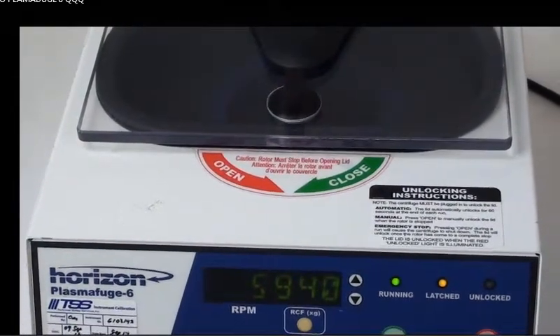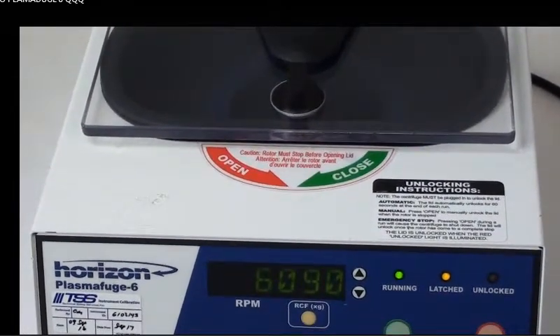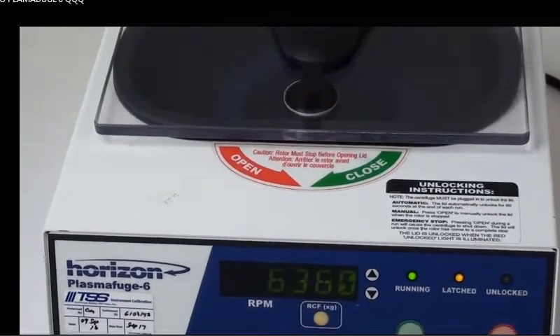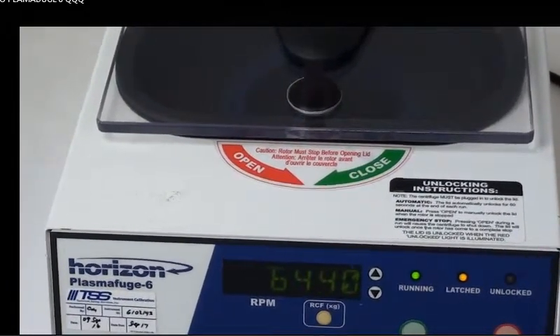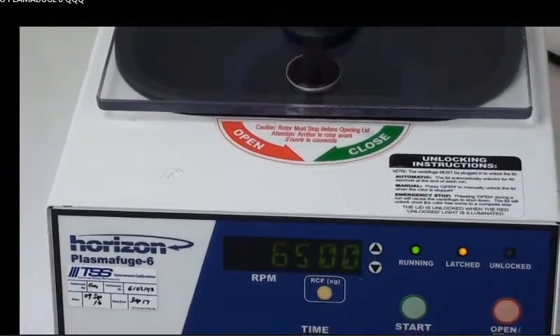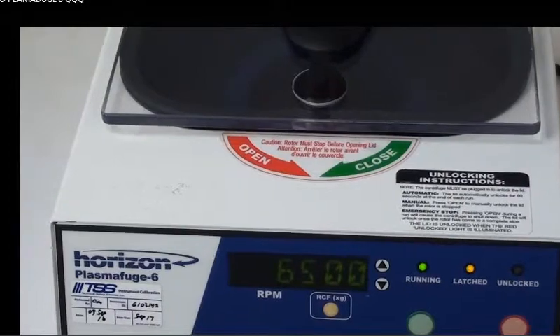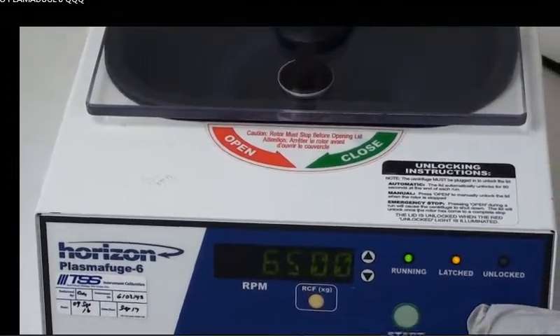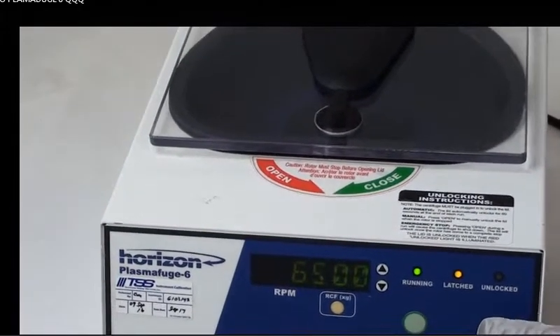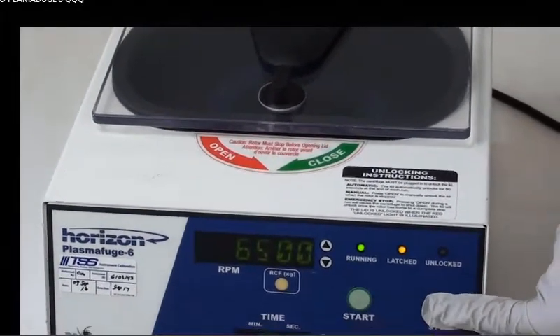We're nearing 6000 and we're right at 6500. I'm going to let it run, and when I'm ready to let it brake, I'm just going to press the stop button. You can hear how loud this is.